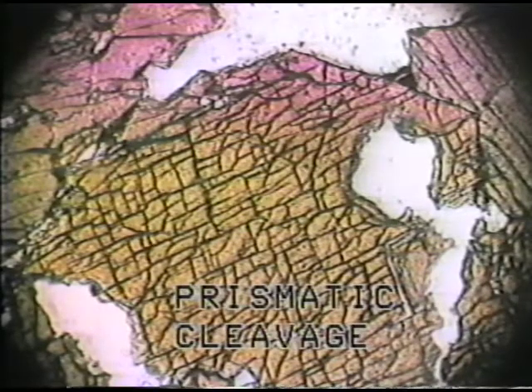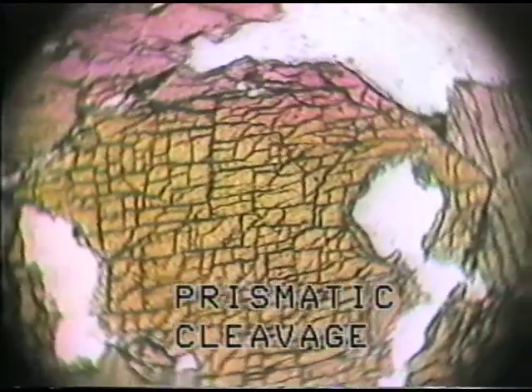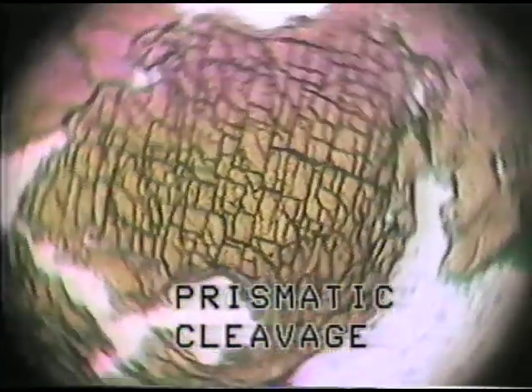This kind of cleavage is a prismatic cleavage, and with pyroxenes and amphiboles in particular, we pay a lot of attention to the angle of intersection between the two cleavage forms when we can see the two prismatic cleavages intersecting.